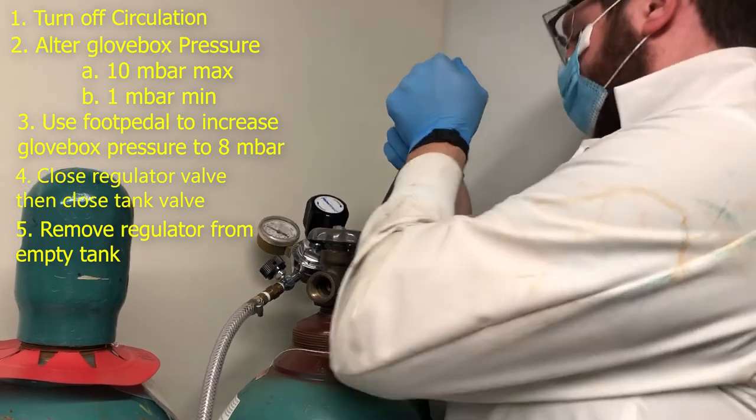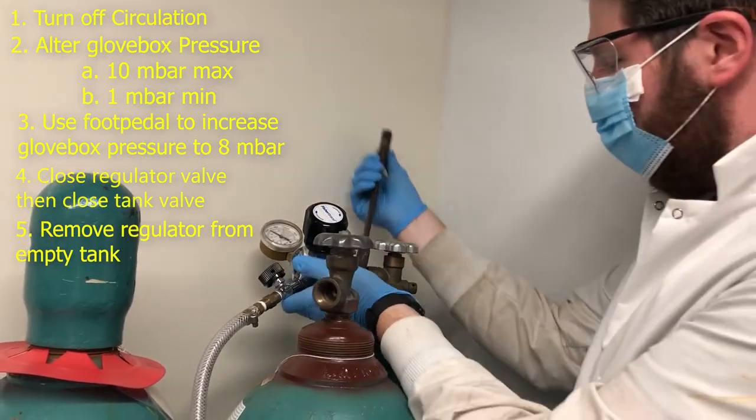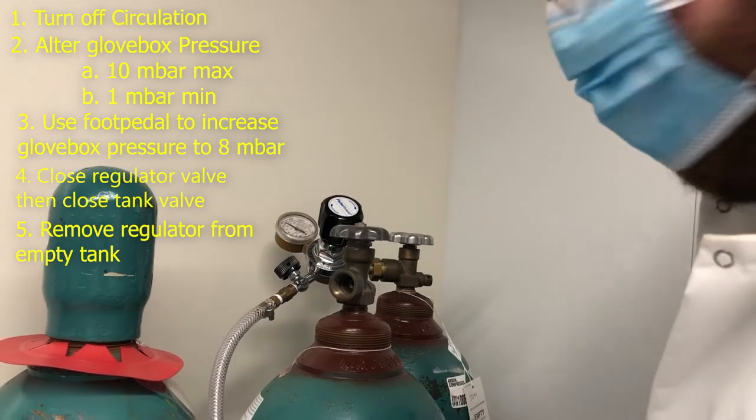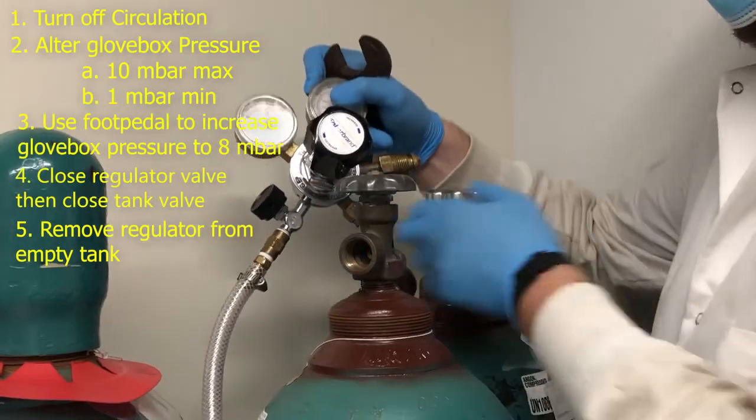I think it's this way. There we go. Woo! That's been on there for like two months. So once it's disconnected.